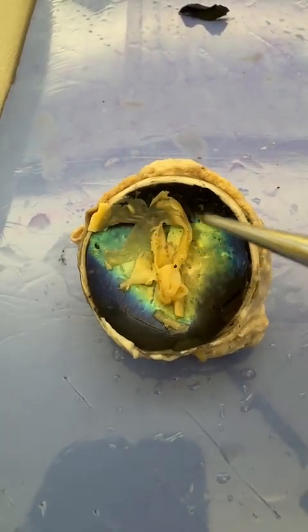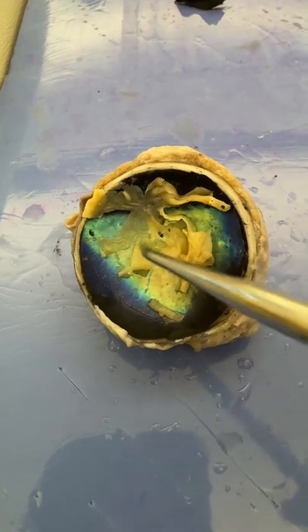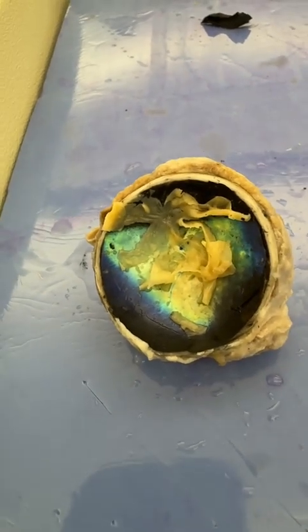Harder to see in a real eye, but there is a fovea centralis, a central focus point on the retina. I have on occasion seen it in real eyes, but not in this one. This one's a little torn up.